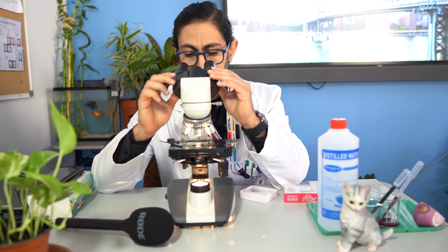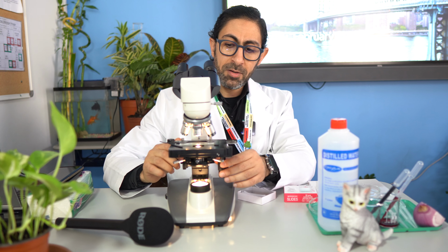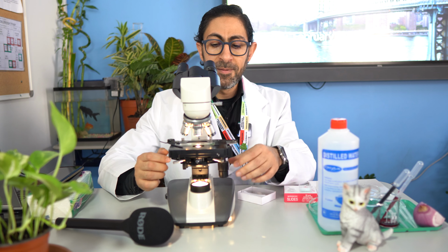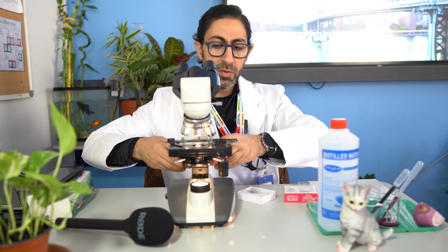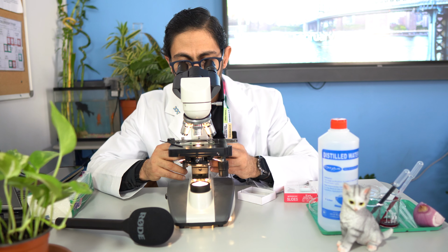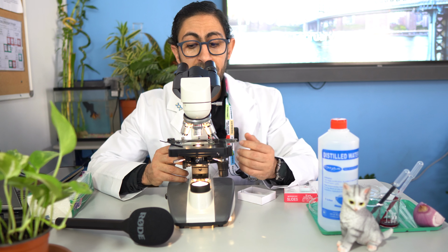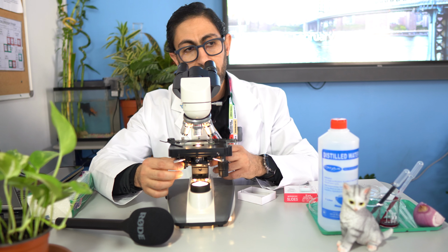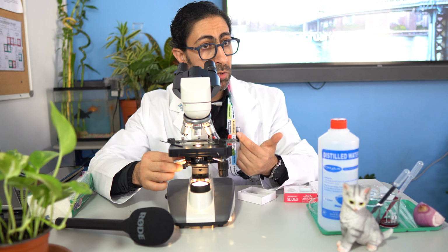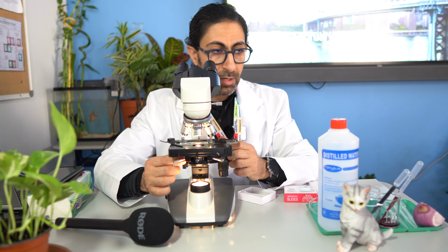So then after being sure that the slide is secured, passing the light properly, and the stage is raised to the highest level using the coarse adjustment, then you will have a look through the eyepiece at your specimen. If the field needs more light, you will control this with the condenser, to control the amount of light passing through the filter.